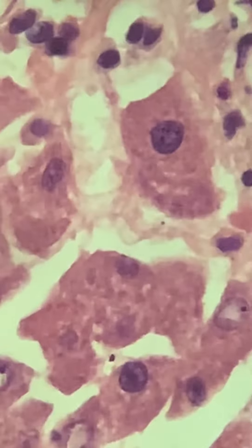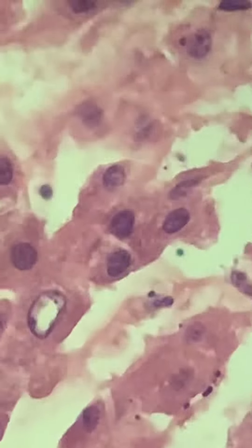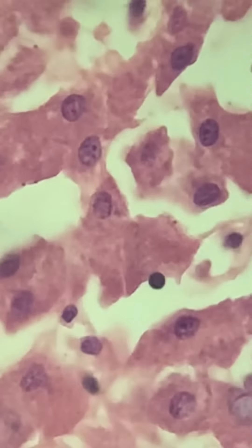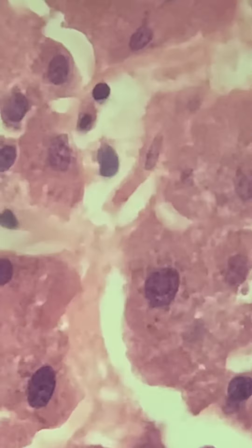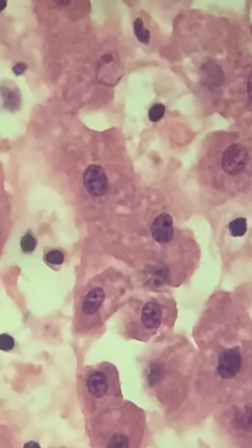Other than that, obviously the person has sepsis so there's going to be some inflammatory changes, but if you look at the liver cells themselves they look very normal — not much in the way of fatty change or steatosis. You would want your liver to look like this, except for the inflammatory changes due to sepsis.